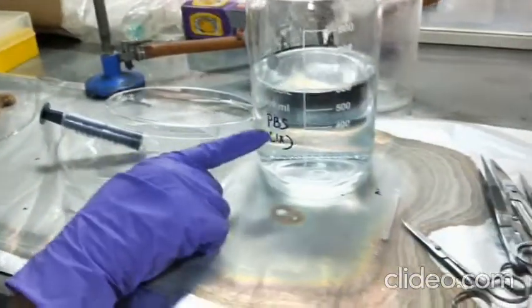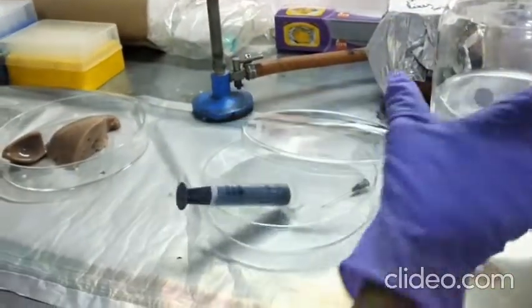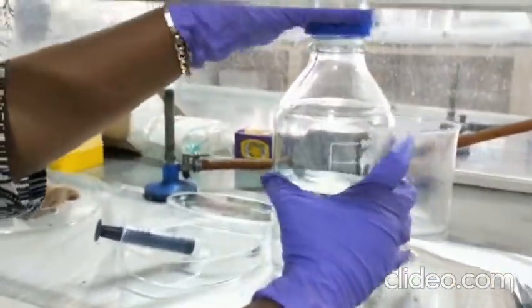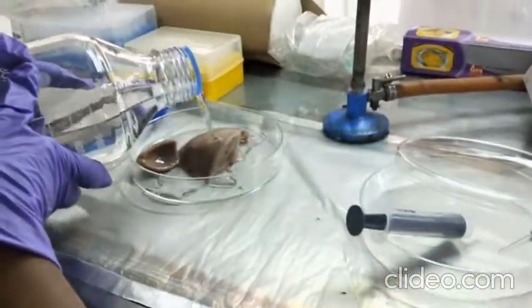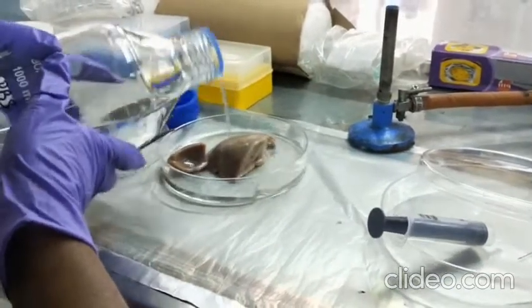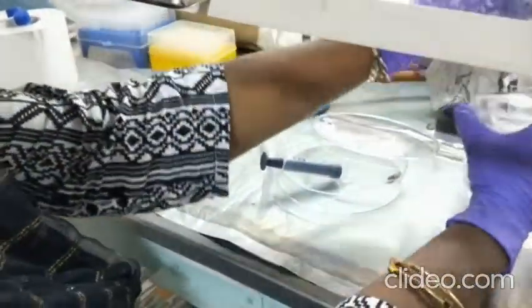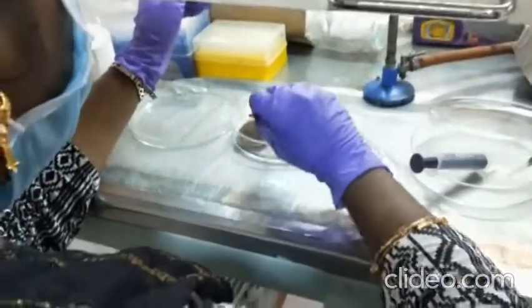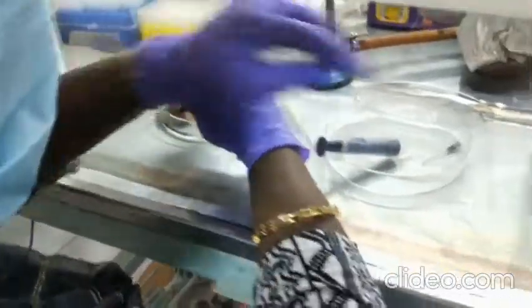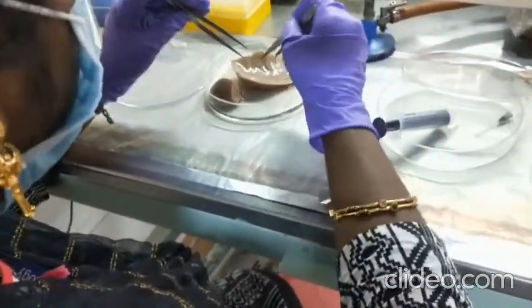We have sterile phosphate buffered saline — PBS — and a sterile syringe. To begin, we need to sterilize and clean the surface of the liver. We need to completely sterilize the liver surface so it is clean and free of any contamination. Proper surface sterilization is essential.